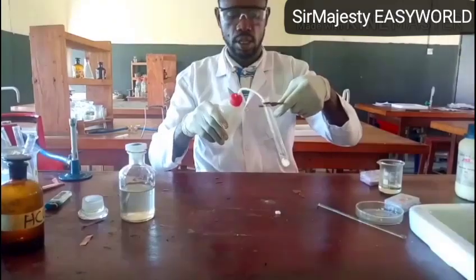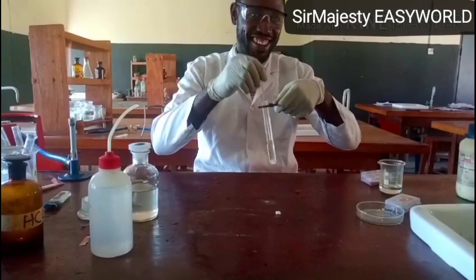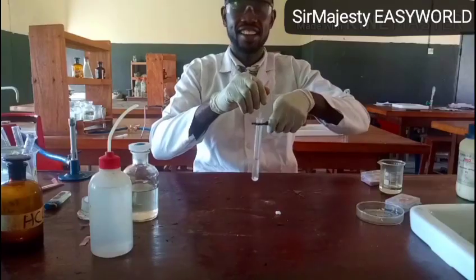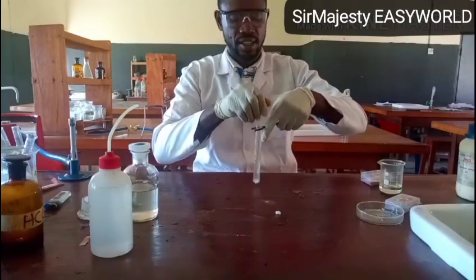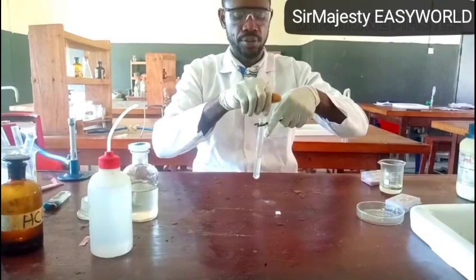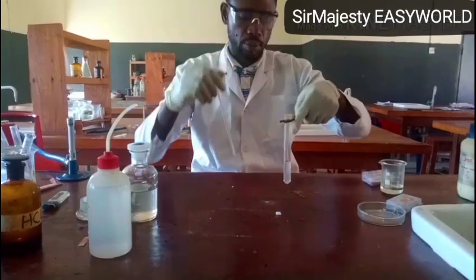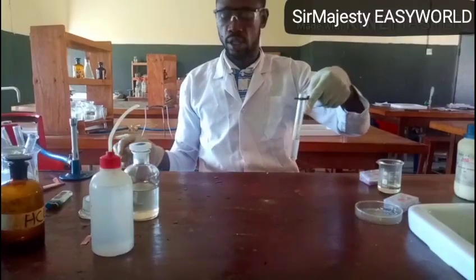So I'm dissolving this in water. Do you have any question there? Dilute HCl. Any acid can do that. When you add dilute acid to any sample, if you see effervescence, a colorless, odorless gas evolving, turning lime water milky, it shows that that sample actually contains CO3 or HCO3.